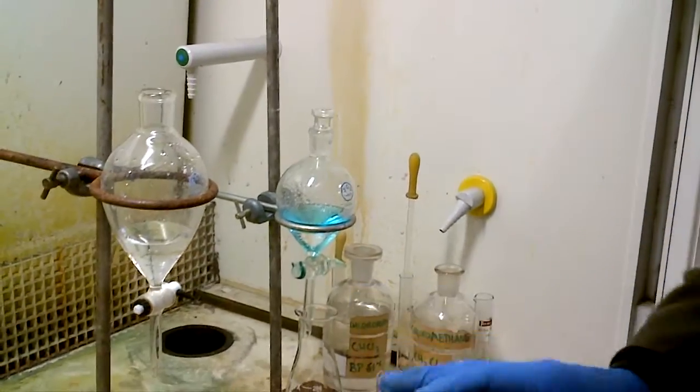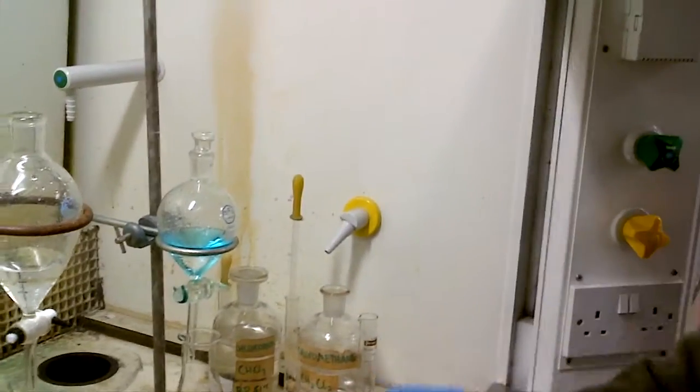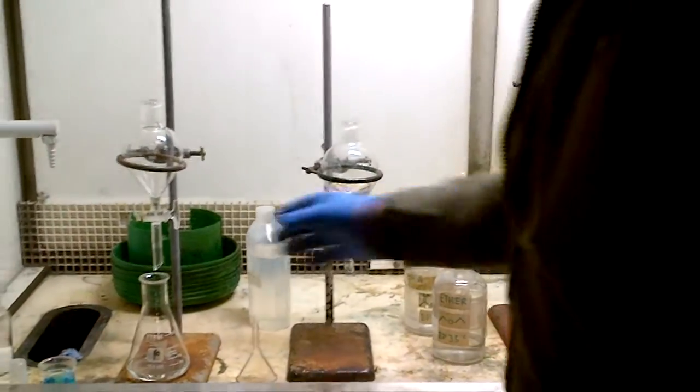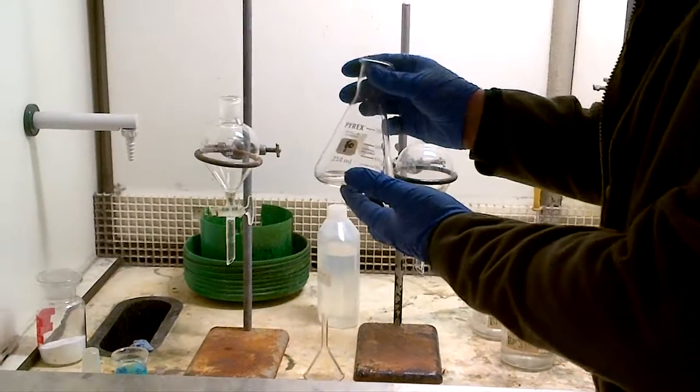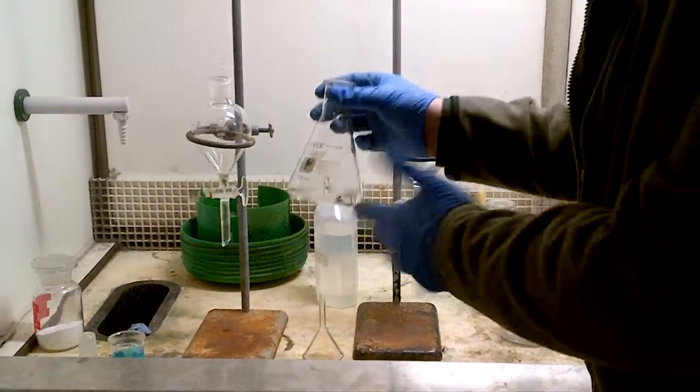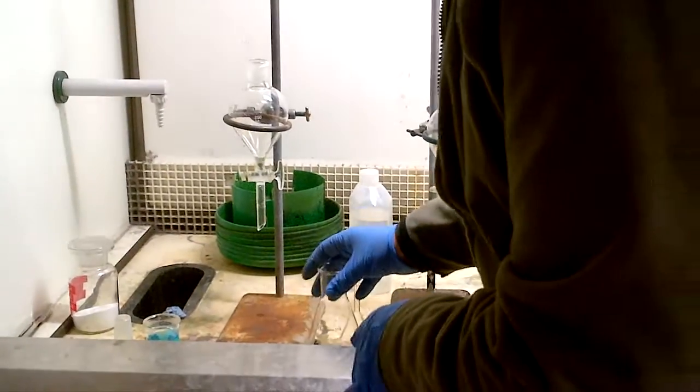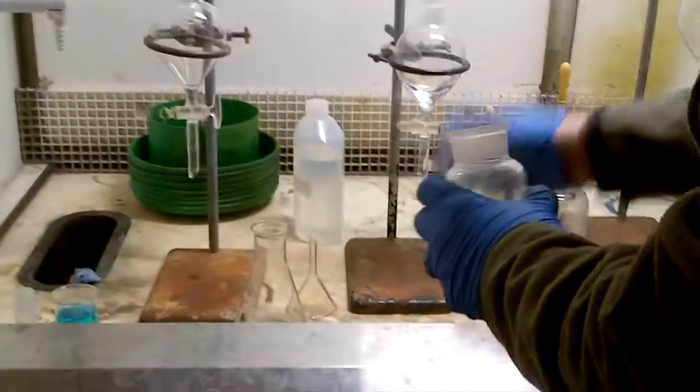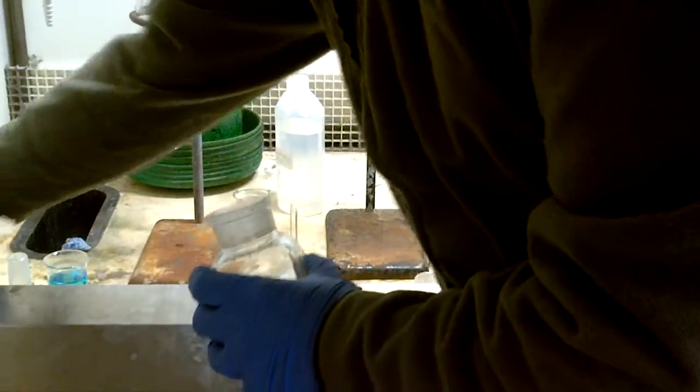But the final thing to kind of say to you on this one, is that if you need to very quickly dry the solution, all we can do now is to say, the organic phase, it has been washed with water, brine, or we're happy with it, just as an extraction, we need to dry it, how do we dry it, we take some mag sulfate.